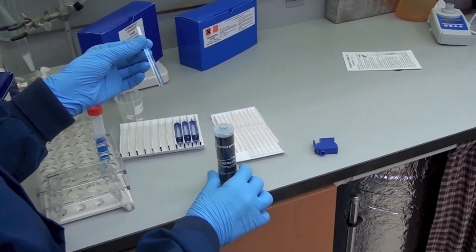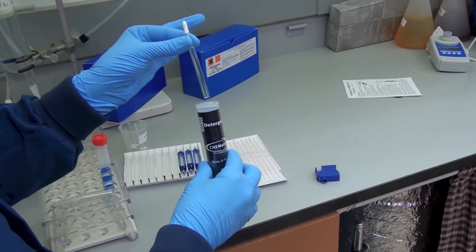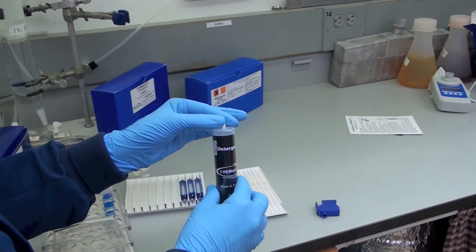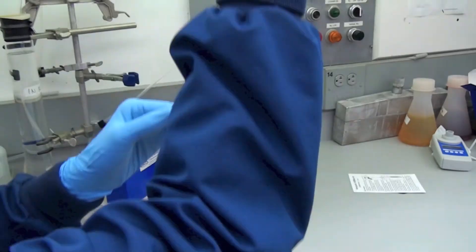Obtain a test result by placing the ampule flat end first into the comparator. Hold the comparator up toward a source of light.